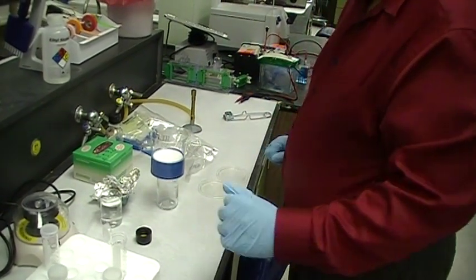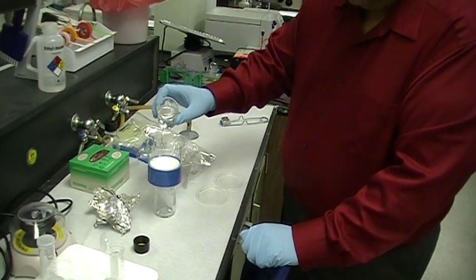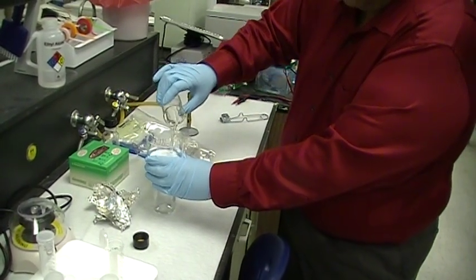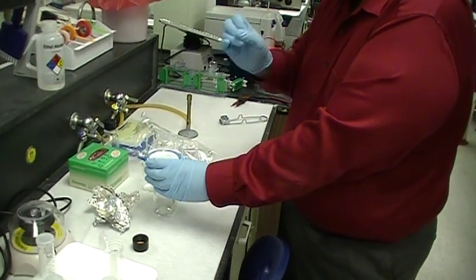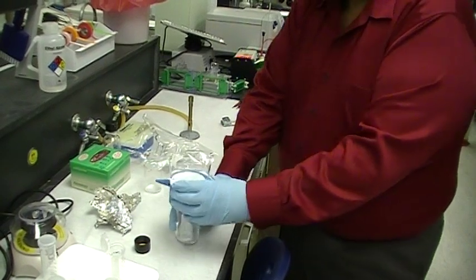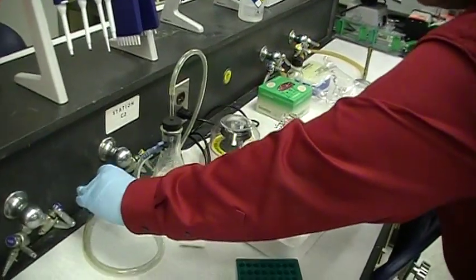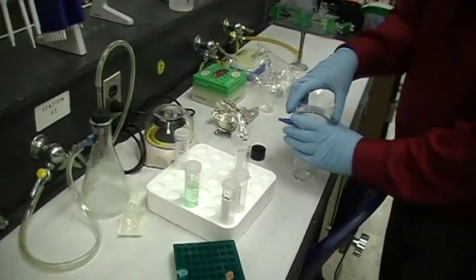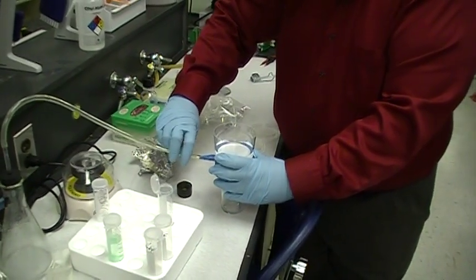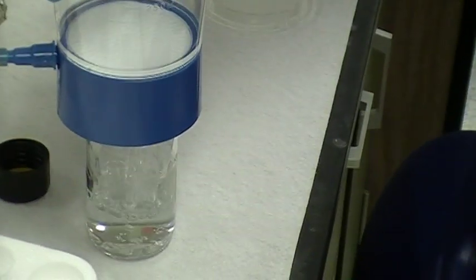Okay, now I want to filter the entire volume right here. It's always good to wet it with your liquid and hold this so it doesn't fall off. And the reason for that is you want the moisture to go through the filter, okay, before you apply the suction. And then you move it towards you, and you turn the vacuum on like so, straight, and you hook this up to the top, and you filter it. And so you see the liquid is running through like so.